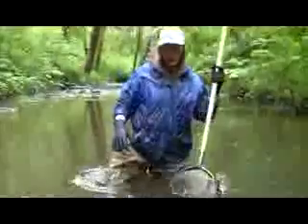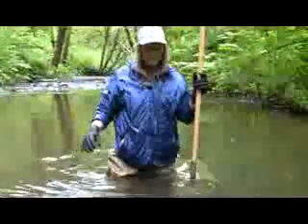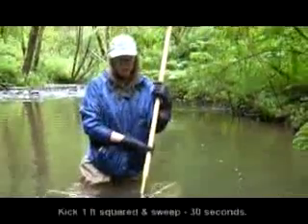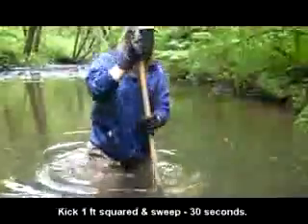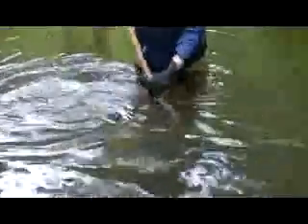So you're going to again visualize a square foot of area in front of you. I'm facing upstream just for standardization's sake. You're going to identify your square foot area in front of you, and you're going to again begin to kick. You're going to kick the sediments up, and then you're going to sweep your net through the cloud of sediment and continue kicking and sweeping for 30 seconds.